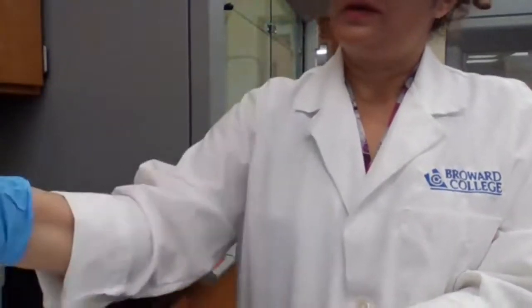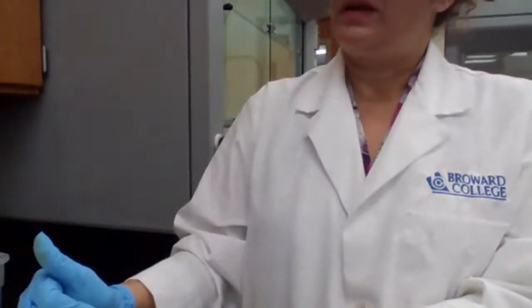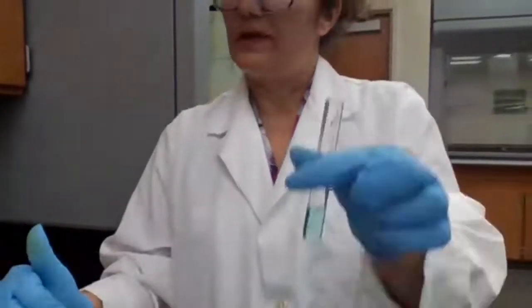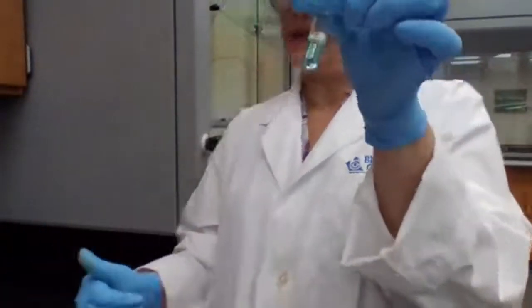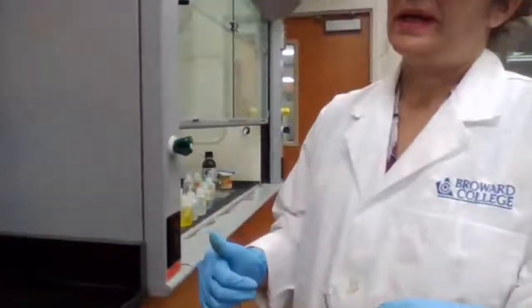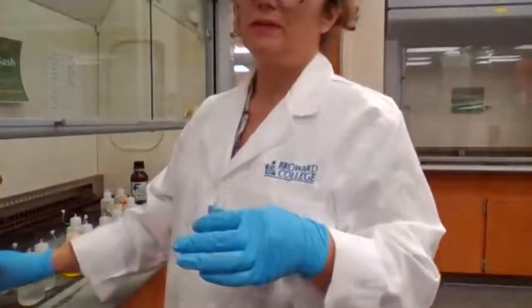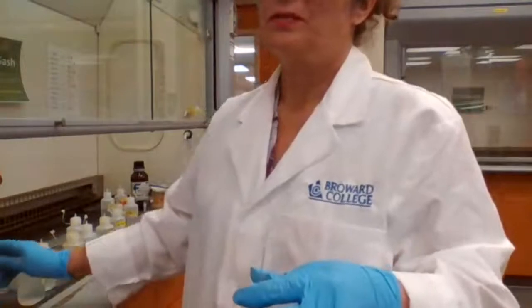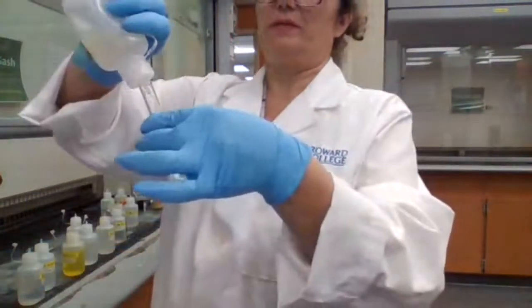And I'm going to do part 2B now. Separation of bismuth, if there is any bismuth. So I add ammonia until it's basic. So I'm adding which ammonia? 15 molar until it's basic.